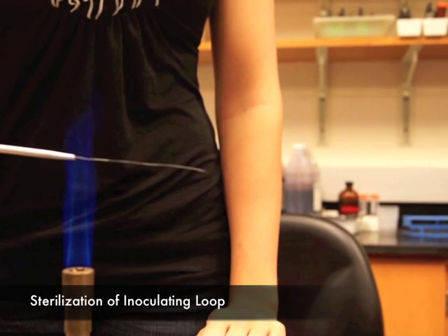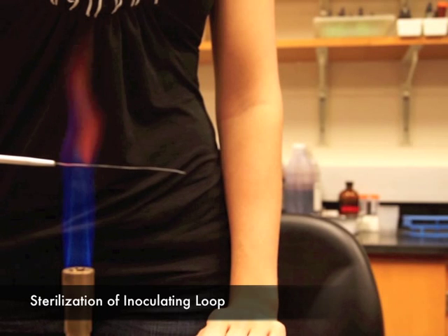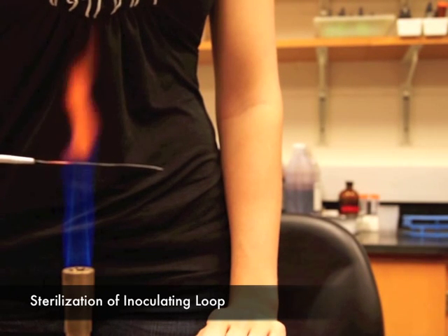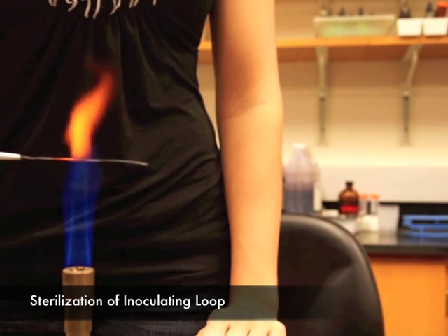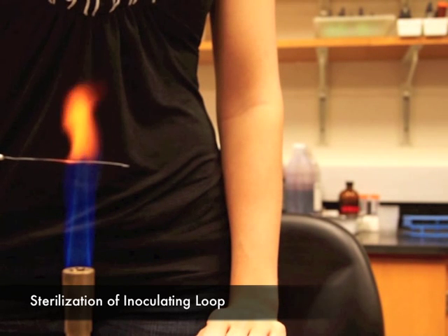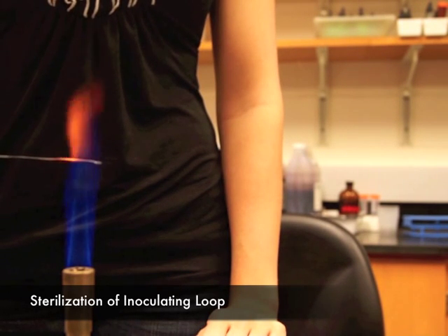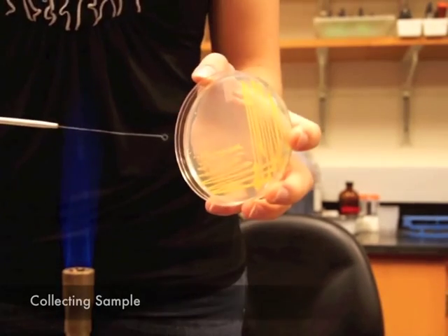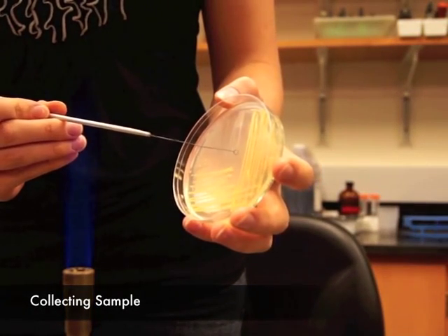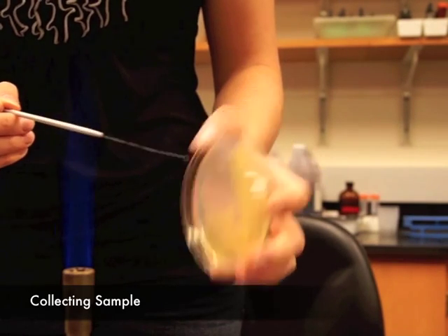Pass the inoculating loop through the tip of the flame to sterilize. Allow the metal to turn orange as it is passed through the flame. Continue to work near the flame in order to remain in the aseptic zone, thereby minimizing the risk of contamination. Touch the loop to the medium to cool it before collecting the sample bacterium from your nutrient agar plate.